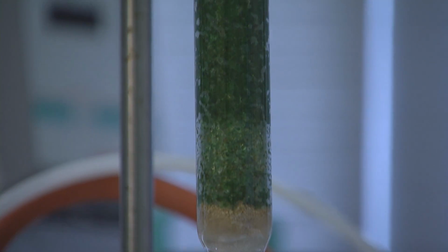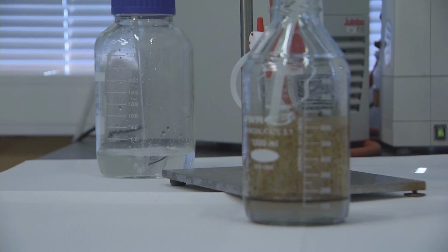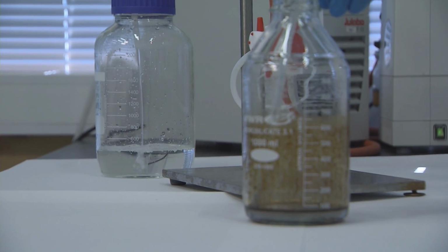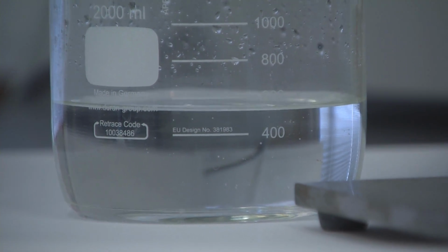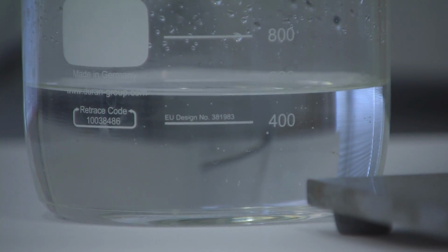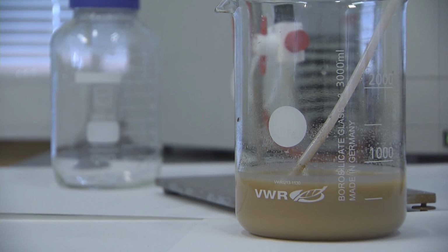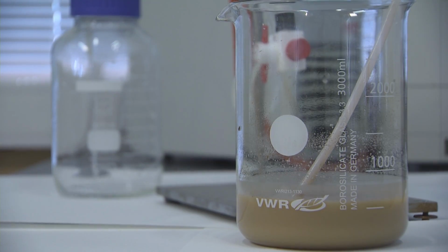The filtration efficiency comes as a result of the tiny oil droplets being encased in SORBFloc and behaving like larger particles, which are trapped and accumulate in the filter, giving us a clear filtrate with about half a ppm of oil. In the absence of SORBFloc, the filter medium, by itself, has little effect on the original untreated oil emulsion.